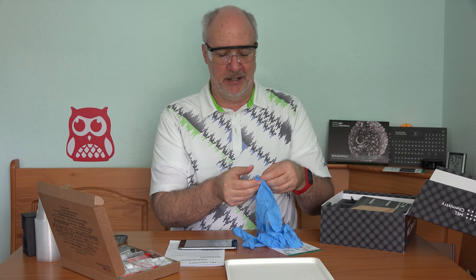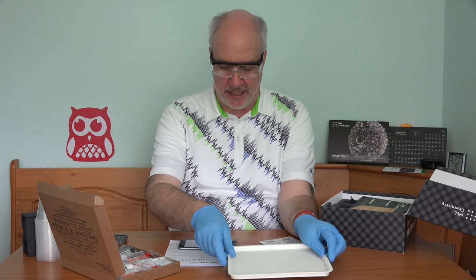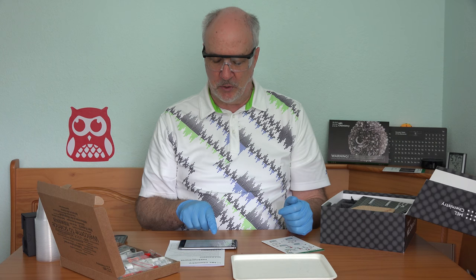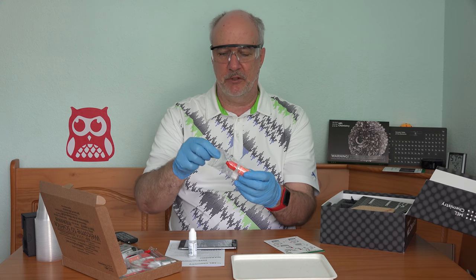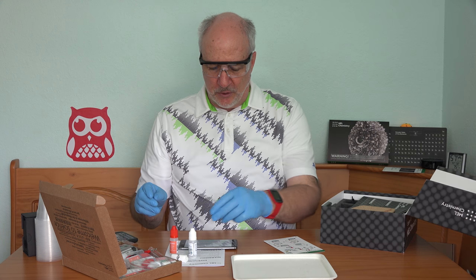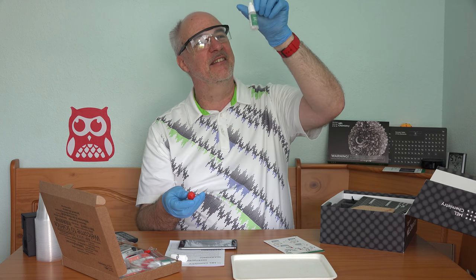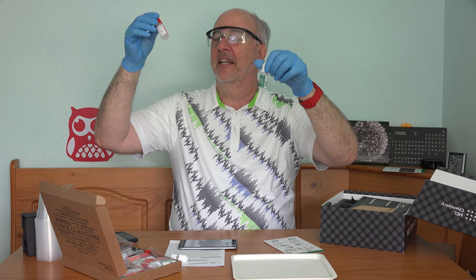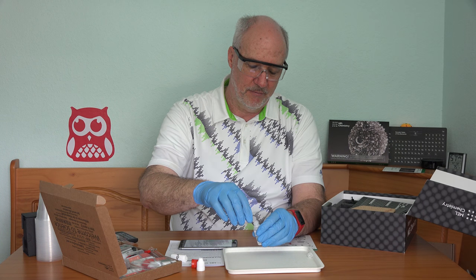This reminds me of doing hair dyeing and beard dyeing product reviews — I feel so surgical. This entire experiment will be conducted on the tray. I need to get my sodium hydrosulfate bottle and my tin chloride dihydrate bottle. These are packaged separately so you know you have the two you need. Place all the sodium hydrosulfate into the vial with the tin chloride dihydrate. There's not much in there — it's a liquid — so I'm going to pour the liquid into here.